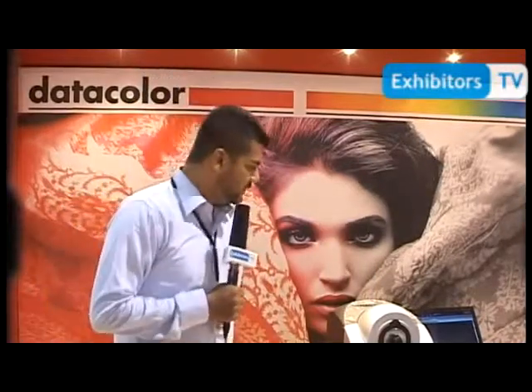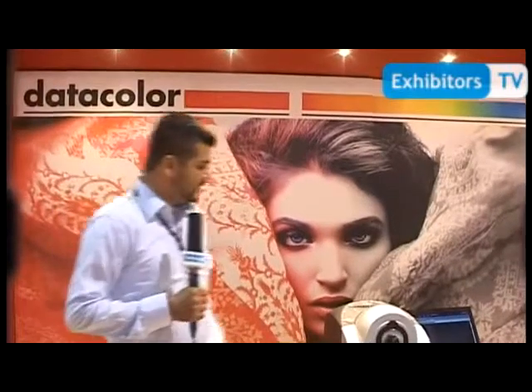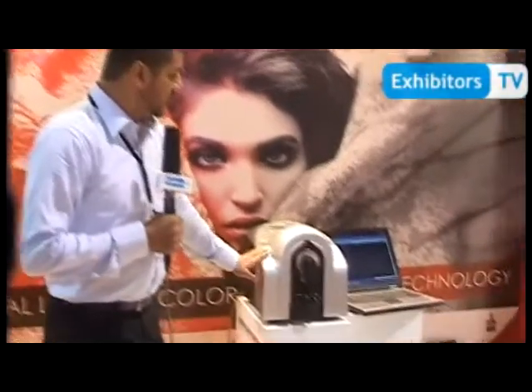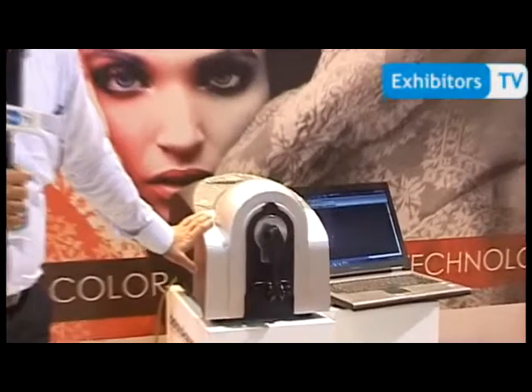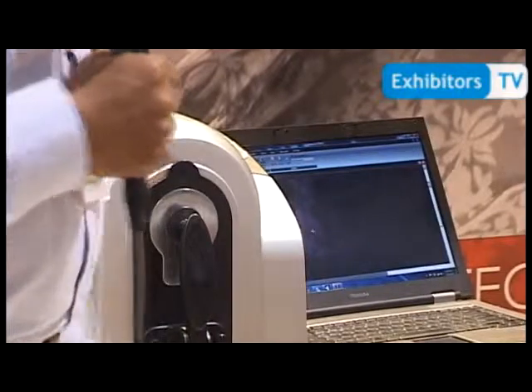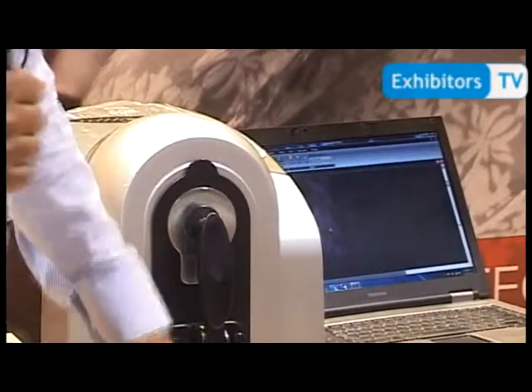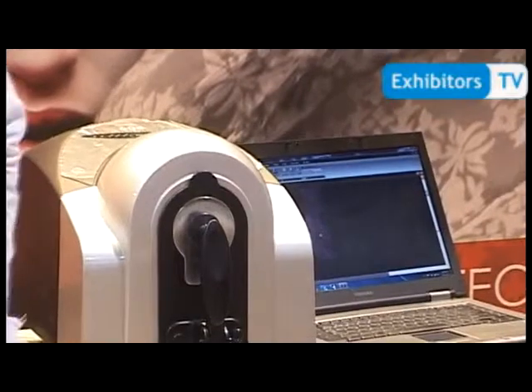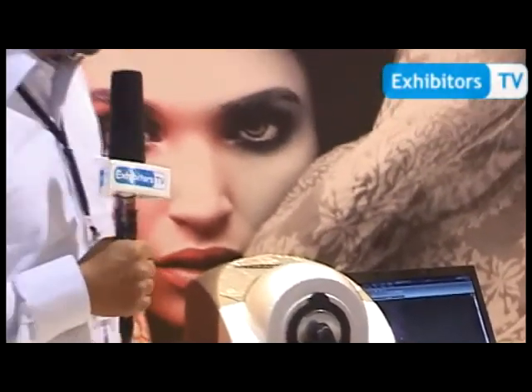First of all we start with the Datacolor. This is a spectrophotometer. This machine is used to formulate the colours and the recipes and it is interfaced with this laptop and the software that contains the formulation and database.